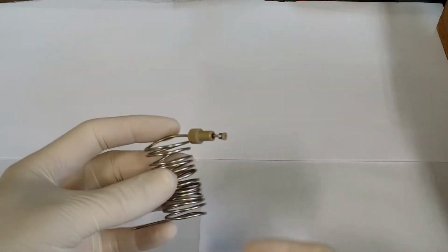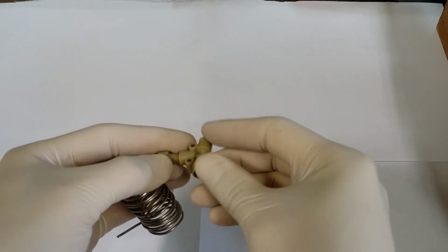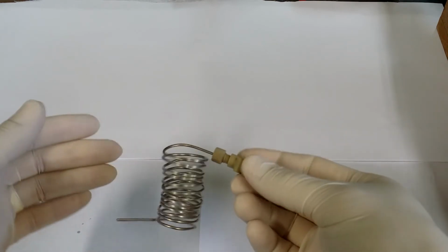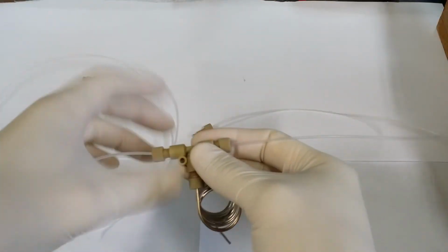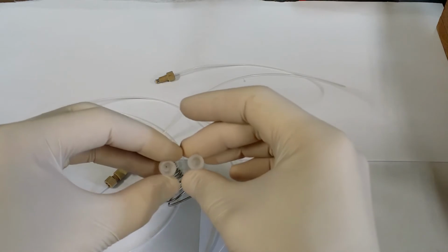The reactor is simply a steel tube recovered from a gas chromatograph. I use 2-piece ferrules and 1/4-inch nuts to make fluidic connections. This T-mixer is placed right before the reactor and serves to mix the reagents. I use plastic tubing to feed the chemicals into the T-mixer. I use plastic because it is much more flexible and won't be in the high-temperature oil bath. These transparent luer adapters are great for joining the tubing to syringes.